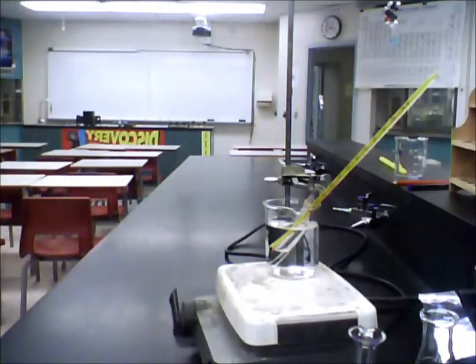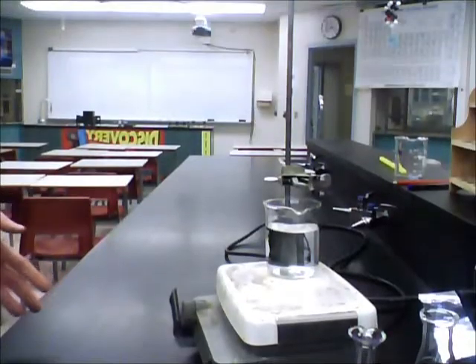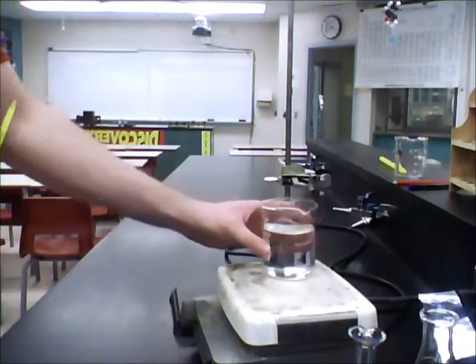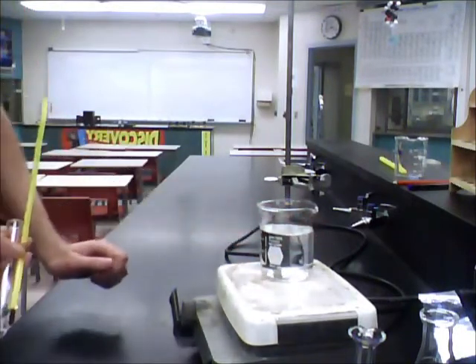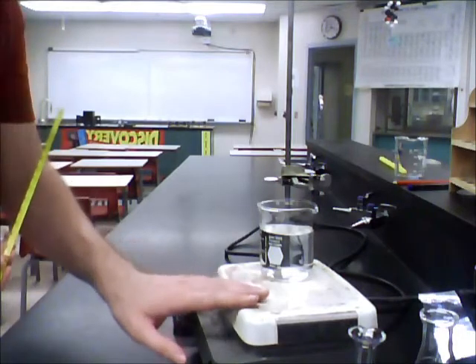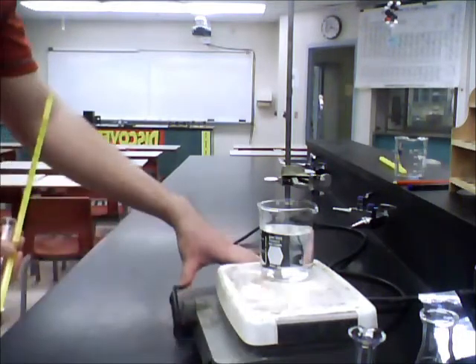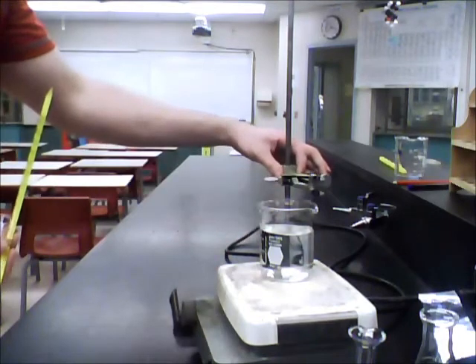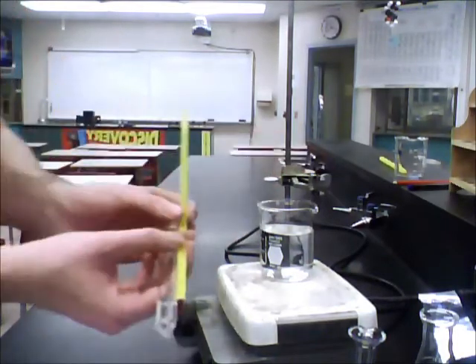Here's how this is going to work. To start off, we're going to have our 250 mL beaker of water, a hot plate which is not on right now otherwise I wouldn't be touching it, and we have a retort stand as well as a test tube clamp. This is going to be used so we can clamp our apparatus.